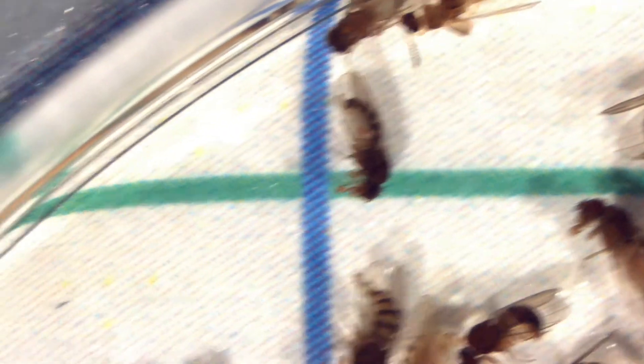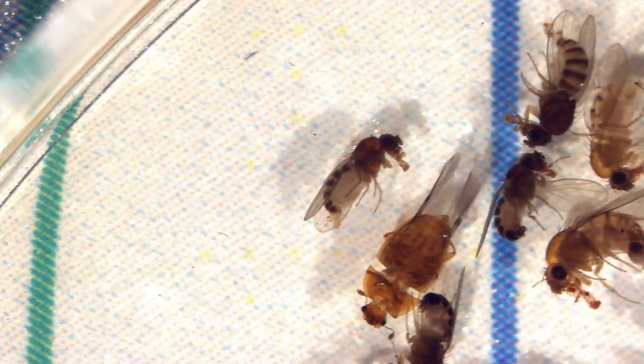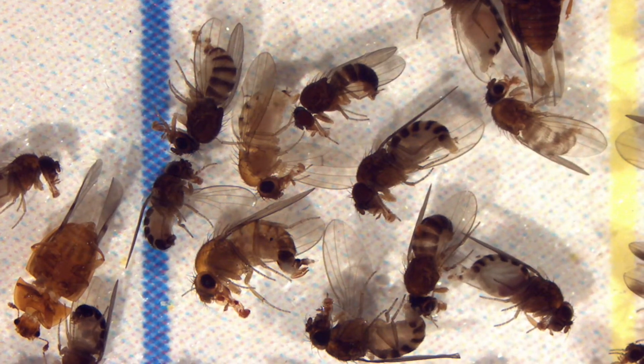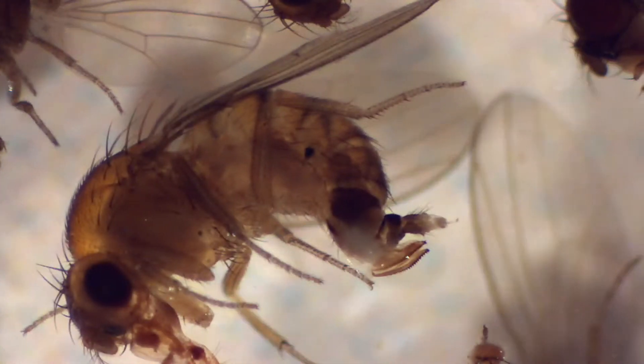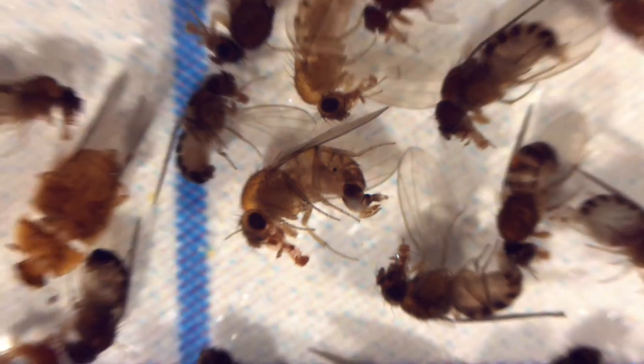I continue searching right to left, go down a grid, all the way to the edge, work my way back to the right. I see something suspicious here — as I zoom in, that looks like a female. Again, the teeth on the ovipositor confirms that as a female.